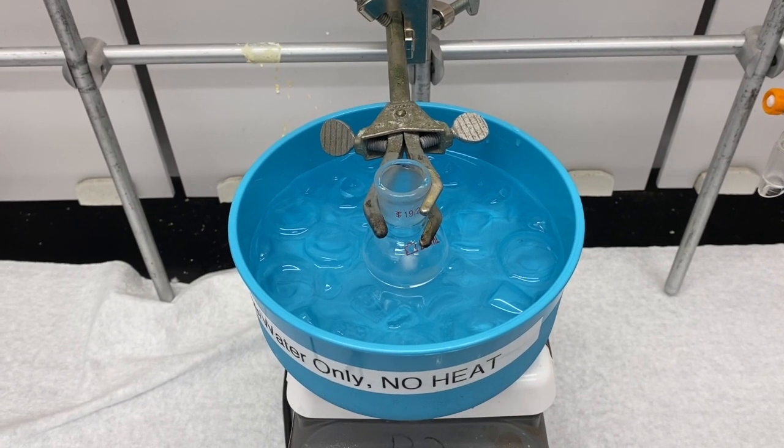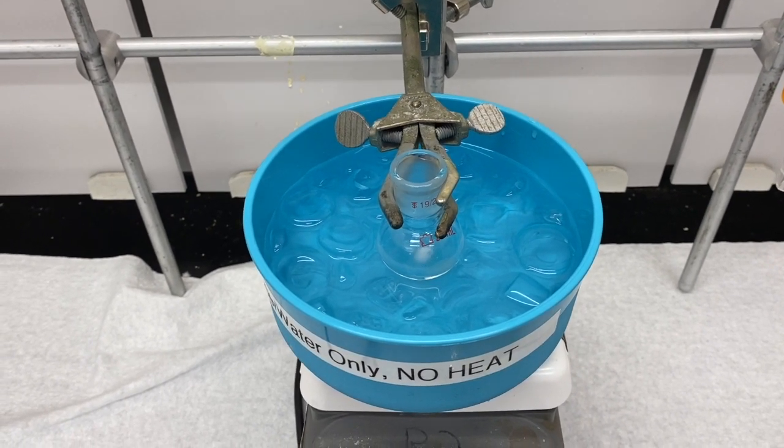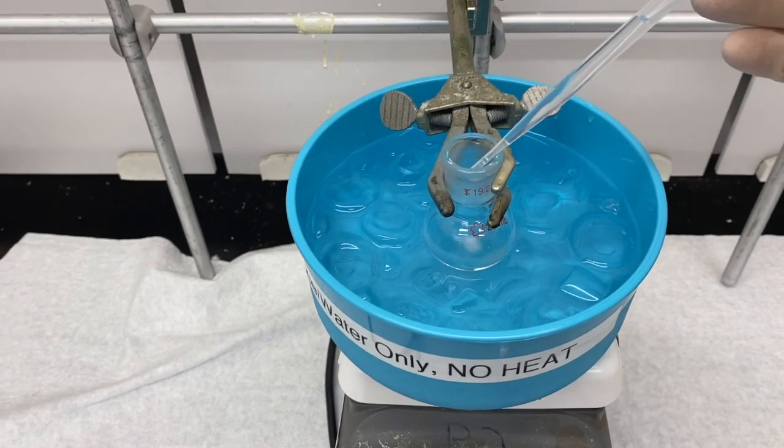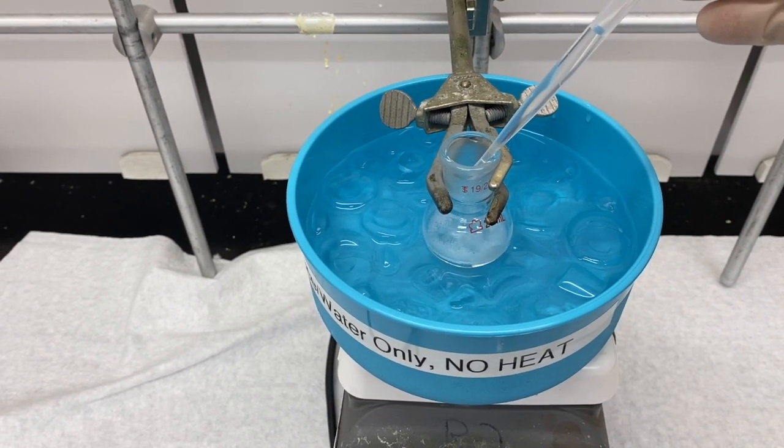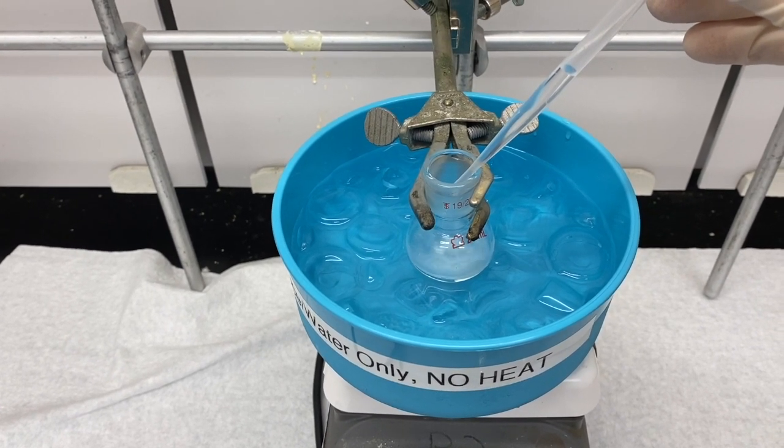So now that the reaction is complete, we have to quench the reaction. So I put it in an ice bath for like 10 minutes to cool down. So now I'm going to add one molar HCl to the reaction slowly to quench it.